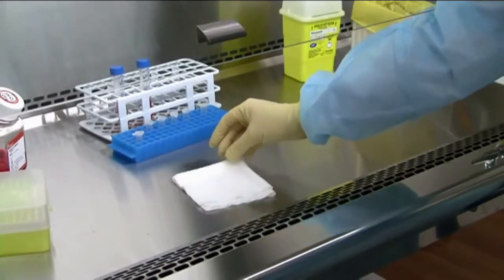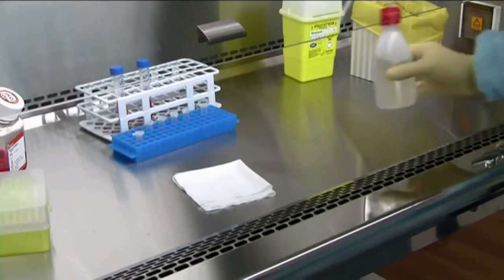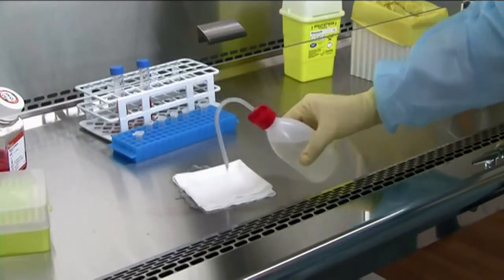Completely cover the spill with a towel and soak with a 10% bleach solution working from the perimeter to the center of the spill.